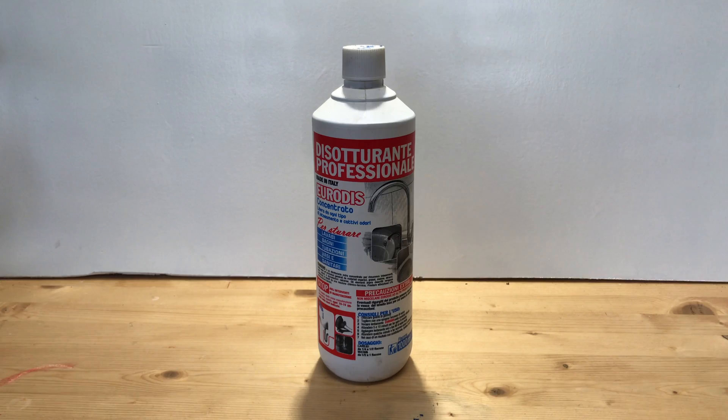For this experience we need concentrated sulfuric acid, which is normally sold as drain cleaner in common hardware stores for a very low price. I paid 5.9 euros for a liter of concentrated acid at 98%.